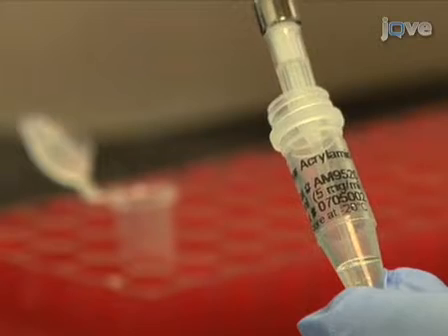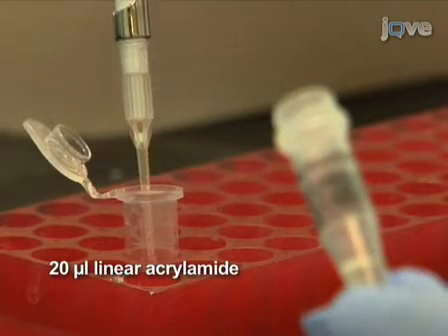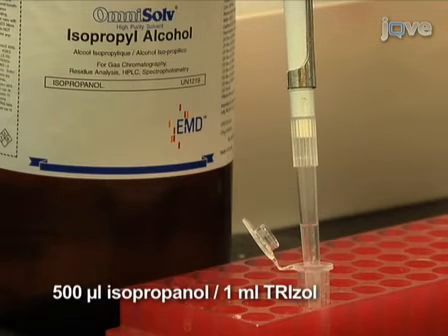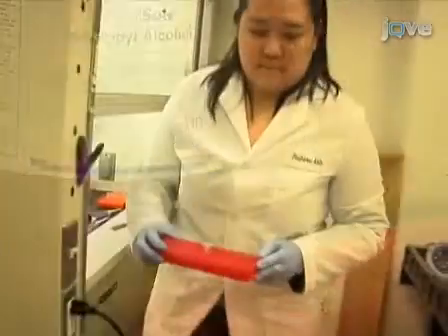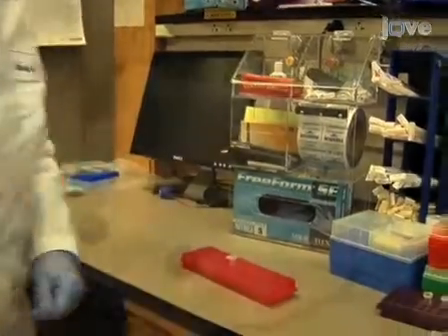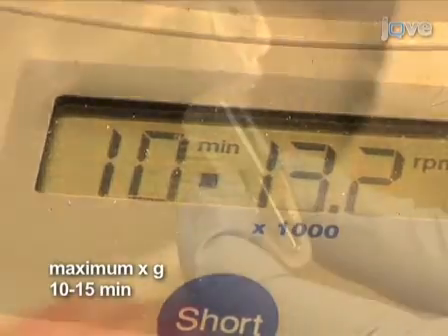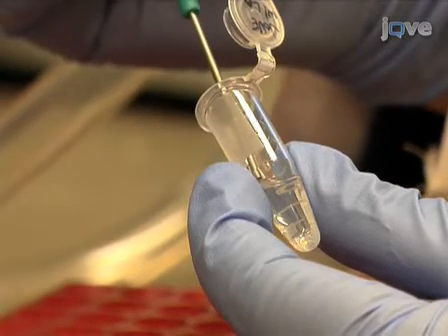Next, add 20 micrograms of linear acrylamide to each sample. The linear acrylamide acts as a carrier and helps to precipitate the RNA. Add 500 microliters of isopropanol per 1 milliliter of trizol you started out with to each sample and mix well. Incubate the samples at room temperature for 10 minutes. After incubation, centrifuge in a microcentrifuge at maximum speed for 10 to 15 minutes. The RNA pellet will be visible at the bottom of the tube after centrifugation.